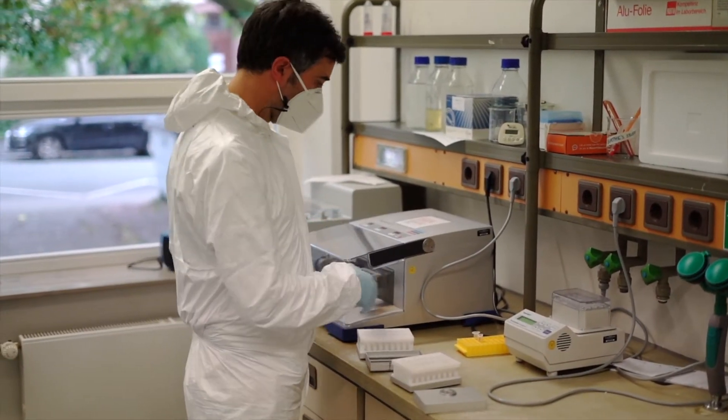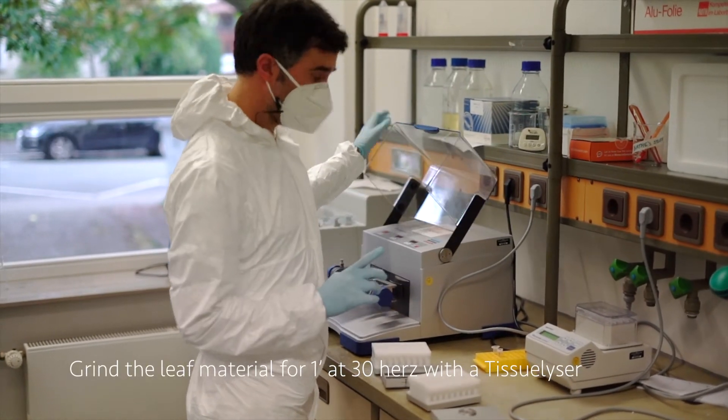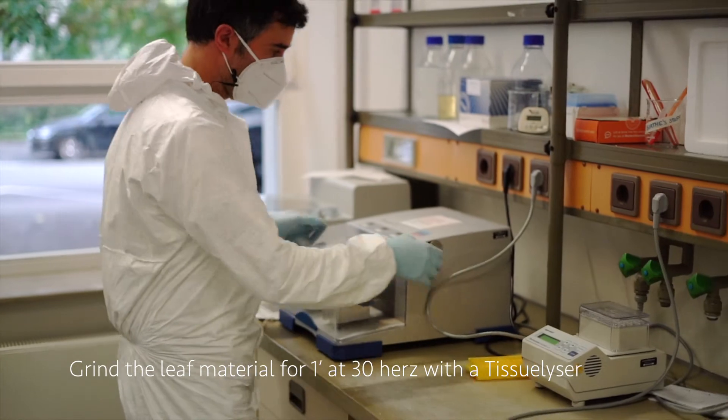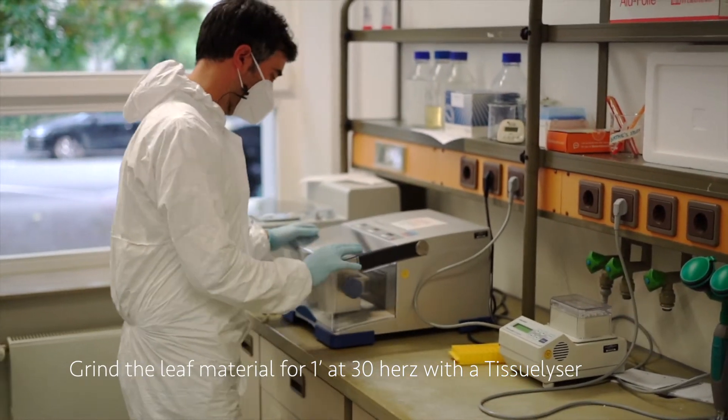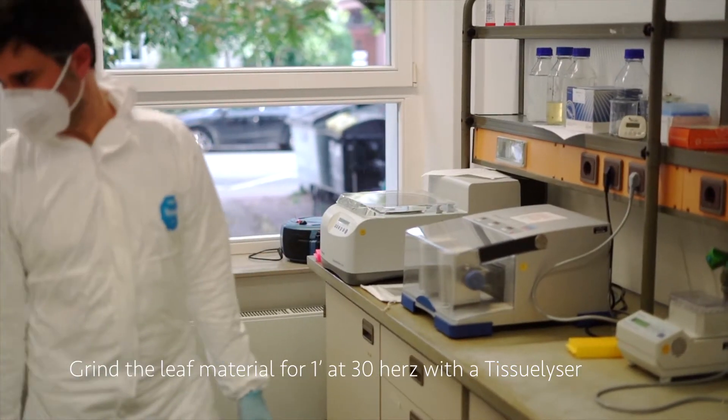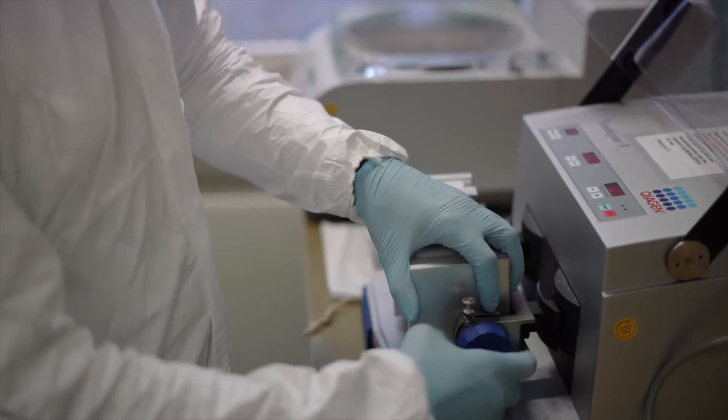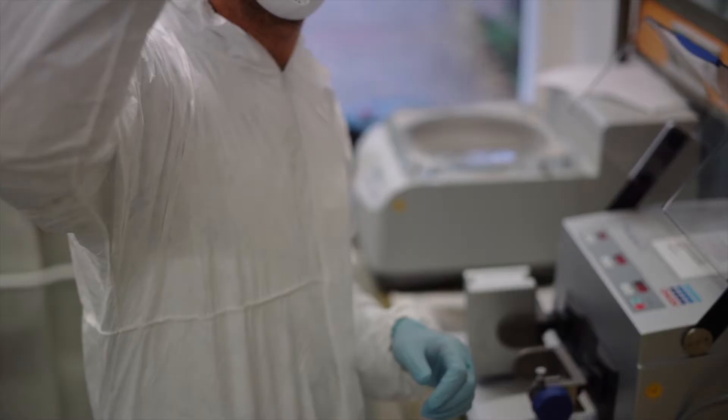Here is the tissue lyser. We are going to grind the leaves for one minute at 30 hertz. Everything has to be balanced. Good, I'm going to start. It looks fine.